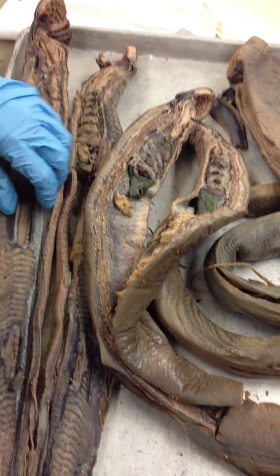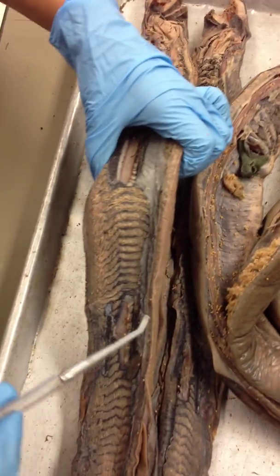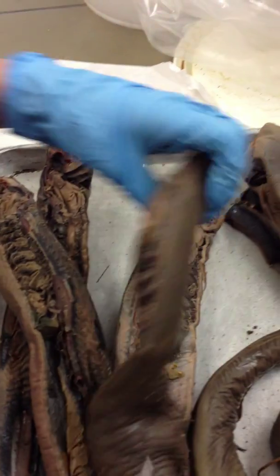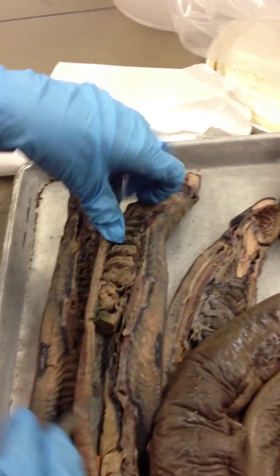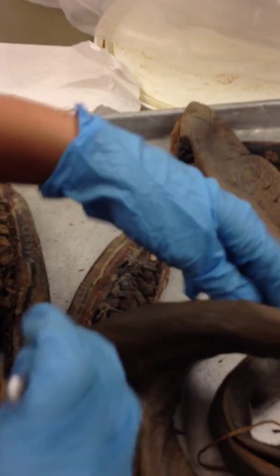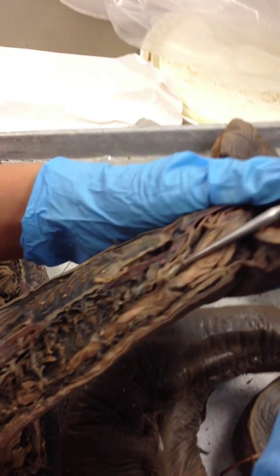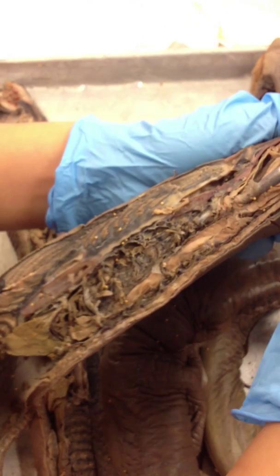We don't know the gallbladder and ventropharynx — I cannot tell you where the gallbladder is. The ventropharynx — I think that was just the thing I showed you earlier, but now I can't find it. You get the idea; it was there somewhere in the beginning of the video. Oh, right here — the pharynx goes right there. Your pharynx.